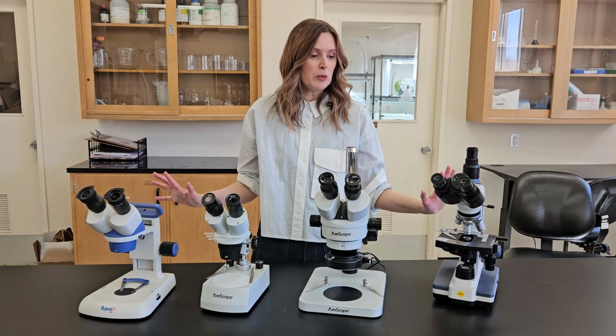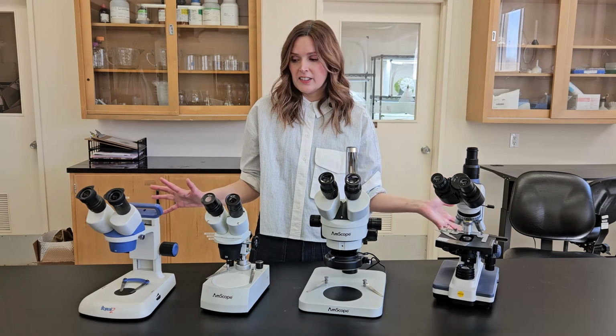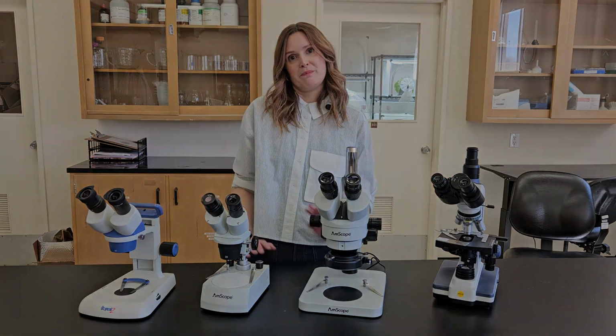So overall, I hope this has been a good introductory lesson to microscopes, and I hope you all enjoy using them in the future.